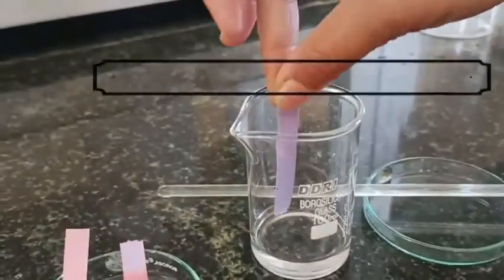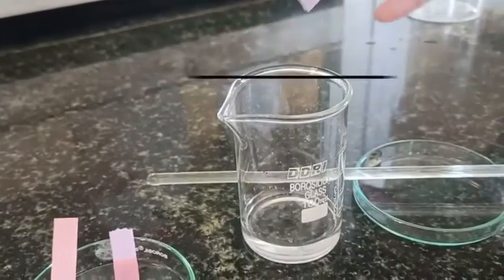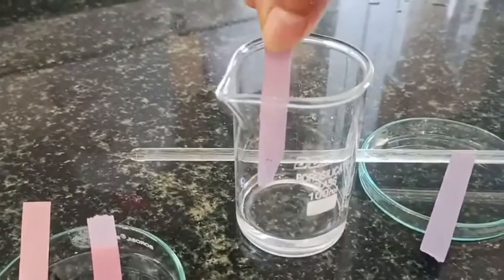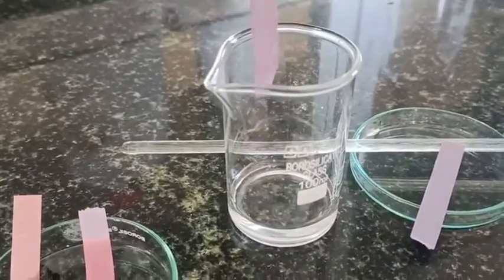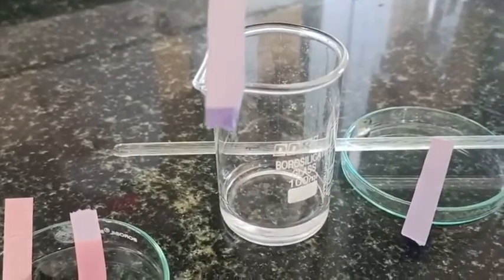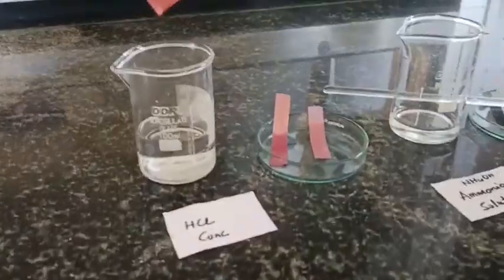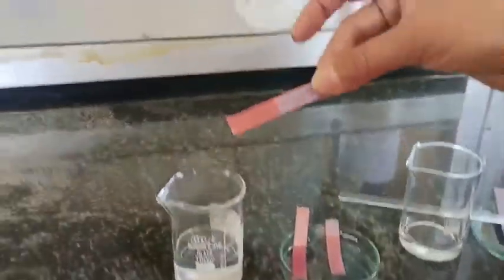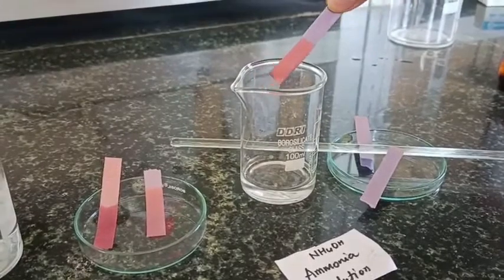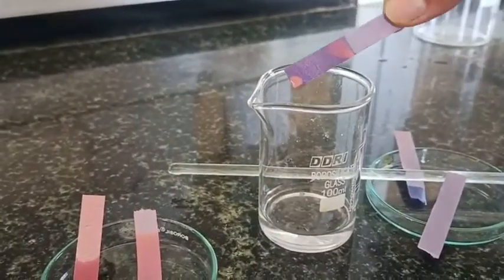Ammonia has the composition NH3 gas plus water, giving us NH4OH. It has very strong fumes. You can see this red litmus paper turns blue by the vapors of NH4OH. Here I dip this into the ammonia solution just to show you — this litmus paper when dipped into the acid turns red, but see the reaction of the fumes of ammonia.